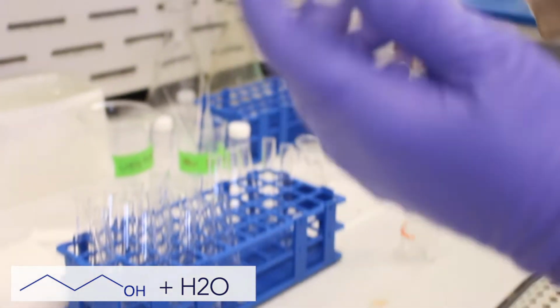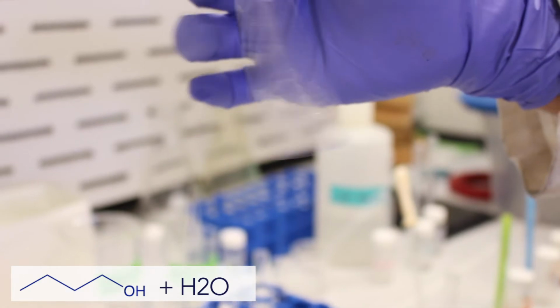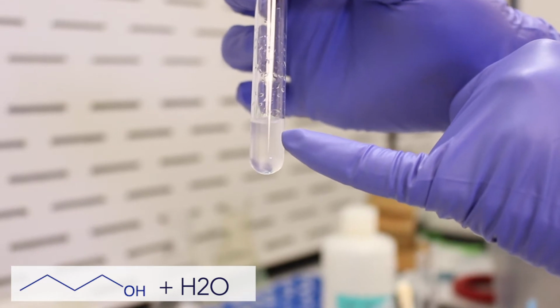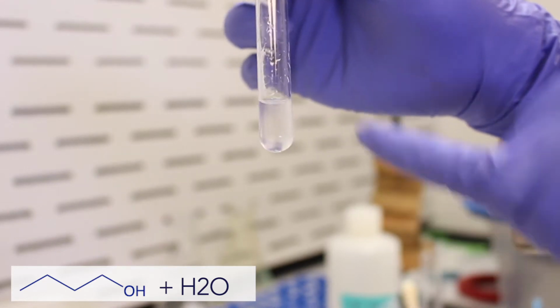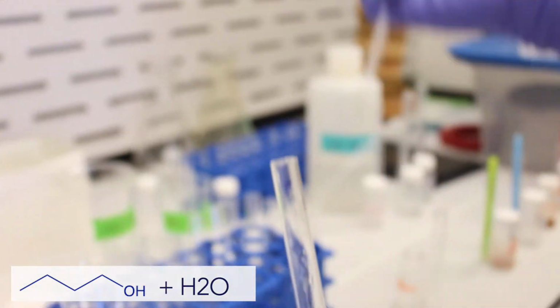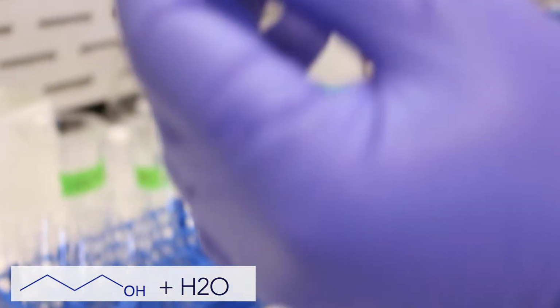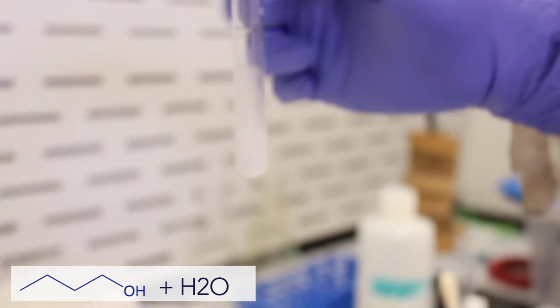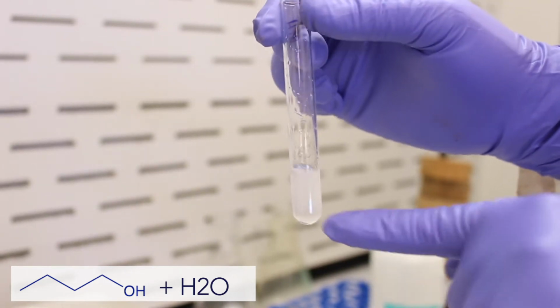And if you can see, if I agitate the test tube, and that's normally done by placing the tube between your thumb and forefinger and then flicking it like this, you can see that they don't mix perfectly. You can see very small pockets of 1-butanol that don't dissolve fully into the water. And given enough time, they will settle towards the top of the solution. So I'll add a little bit more so it's more visible. Okay, so there we've got a thicker layer of 1-butanol floating on the top, and no matter how much I mix it, they're not going to mix. It's not soluble in water, and eventually, given enough time, it'll settle out.